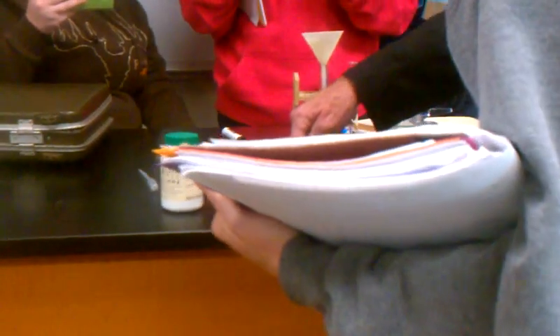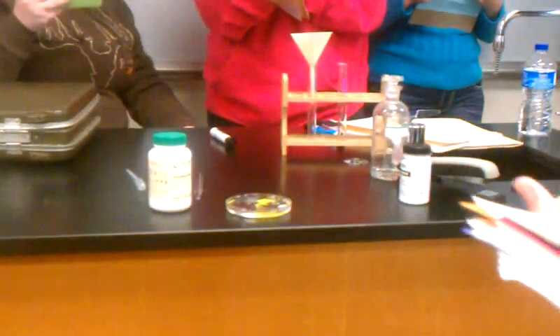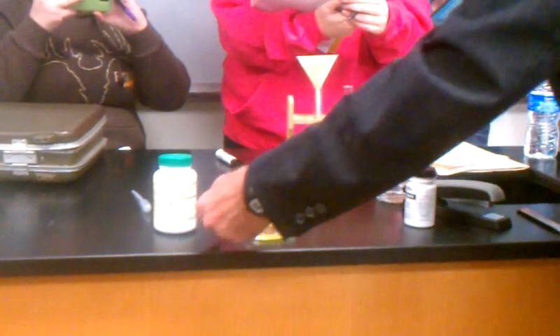What's interesting is how it forms that border between the two edges. Over here was the potassium iodide, and over here was the lead nitrate. You can no longer see any crystals of potassium iodide, because they all dissolved by now. And this — all of it that hasn't dissolved yet is the only difference. It takes a little longer for it to dissolve, but eventually it would all dissolve.